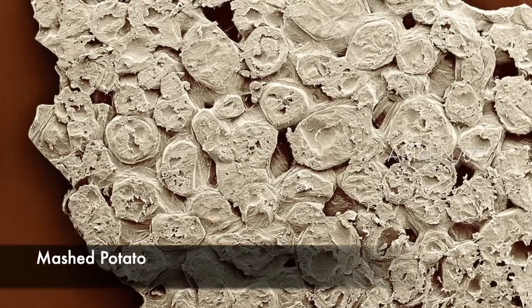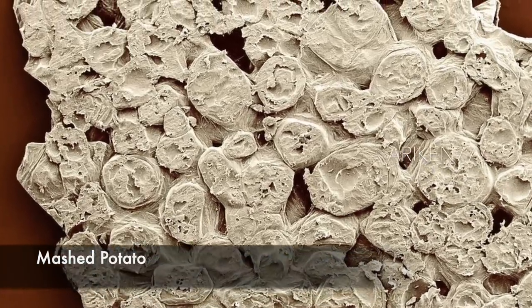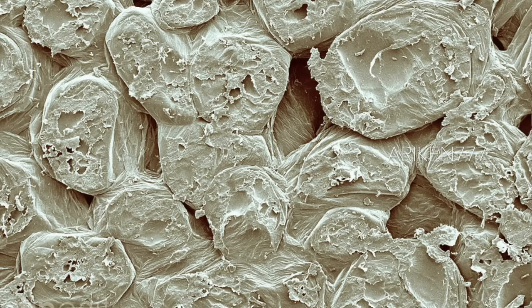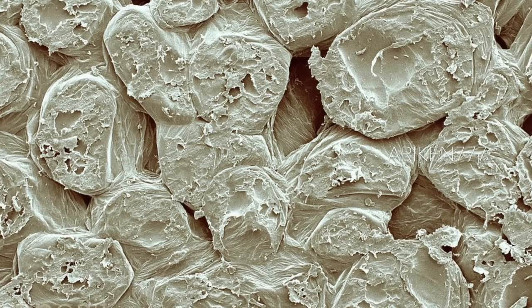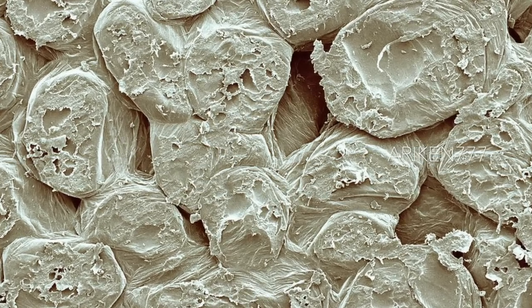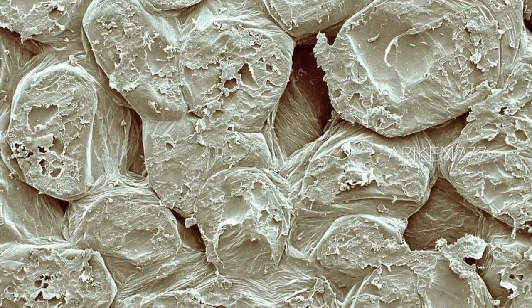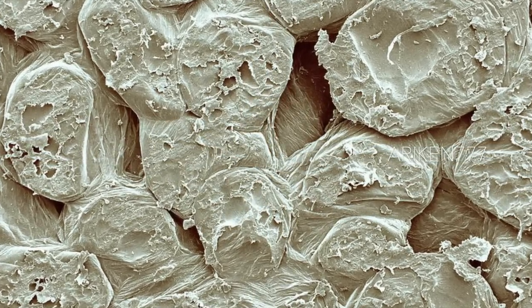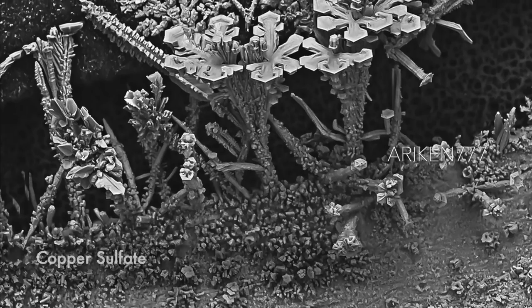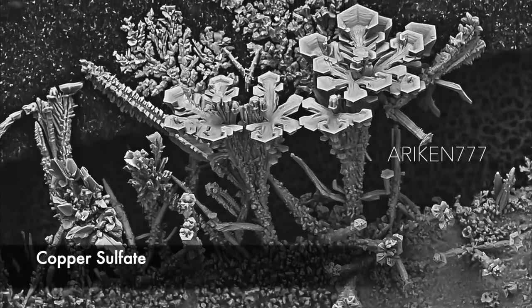Instant mashed potato flakes, showing flattened starch granules which are the major component of the flakes. These are growing copper sulfate crystals.